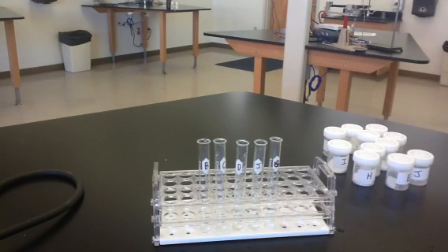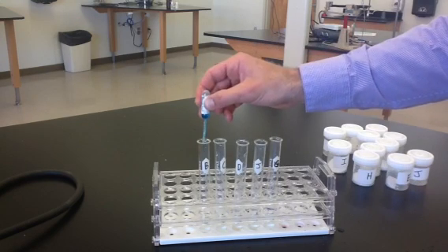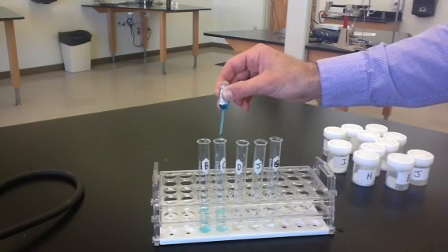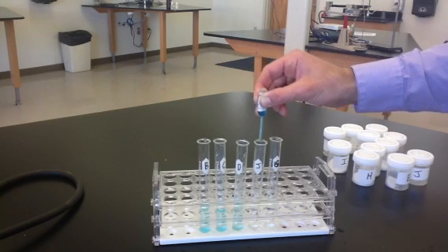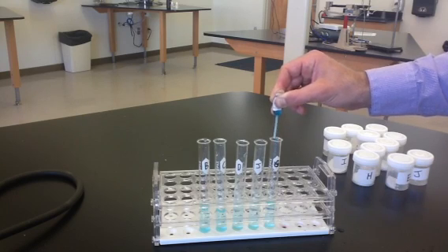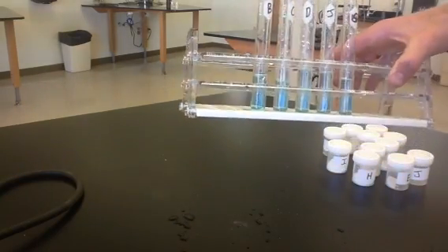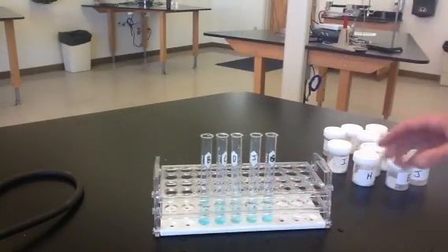We know all of those are soluble. Now for this solution, we're going to add a little bit of Benedict solution. When we add the Benedict solution, you'll actually see no reaction occur right away — it dissolves and makes kind of a blue solution. But they all look exactly the same, so that doesn't help us to identify them.